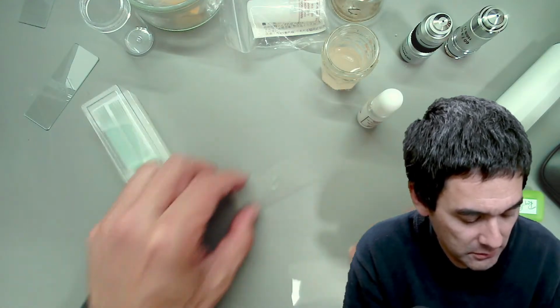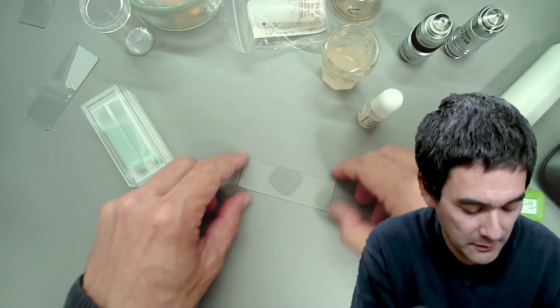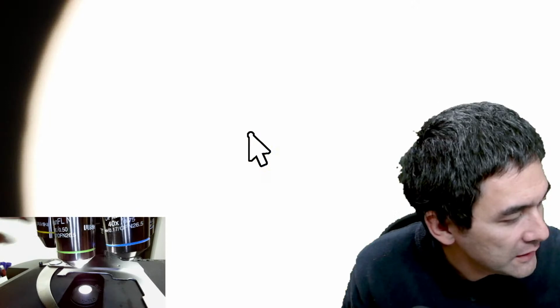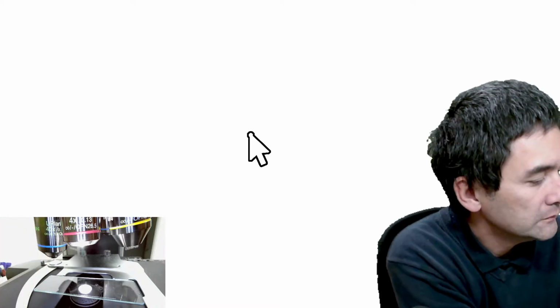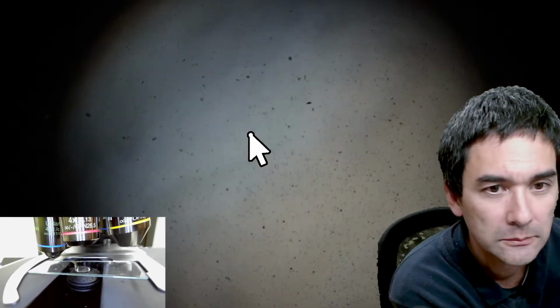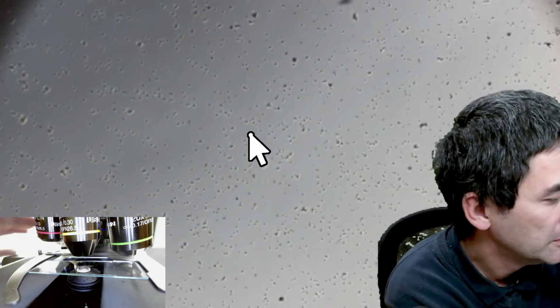So, let's go for it again. This is now a yeast suspension. Let's have a look at this again. Microscope view. Let's go all the way down again to the low power. Let's go up. If I can find it. Yeah, all of those dots that you see over here, probably yeast cells. Let's go up with the magnification.